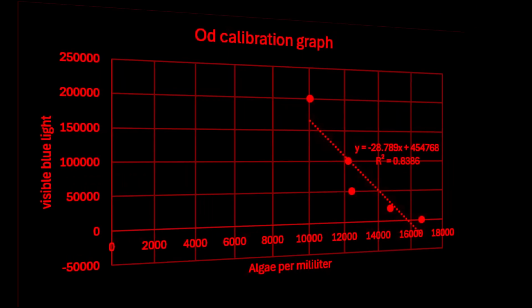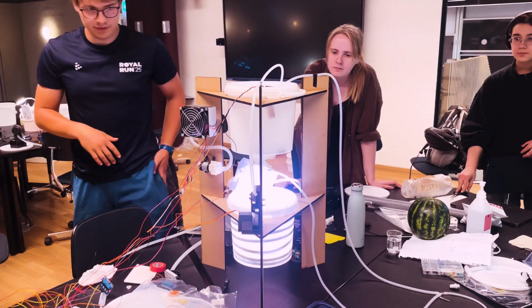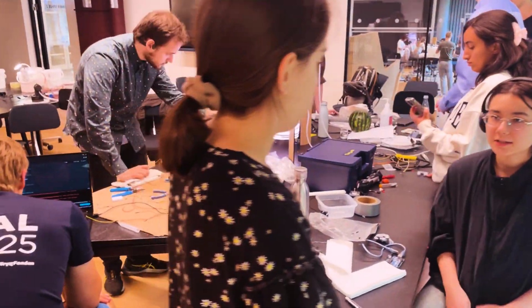However, the resulting graph produced an R-squared value of 0.8386. This is not ideal, but the OD sensor we use lacks the sensitivity required to provide a fully reliable basis for OD readings in our system.